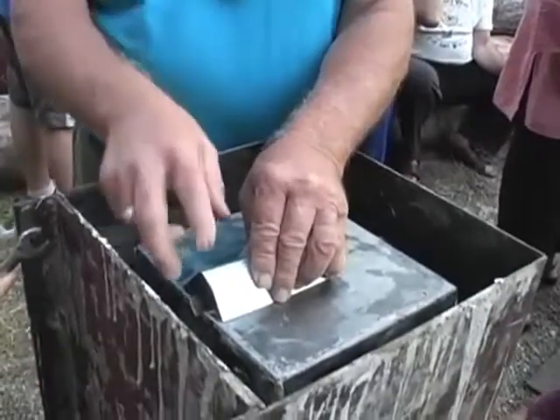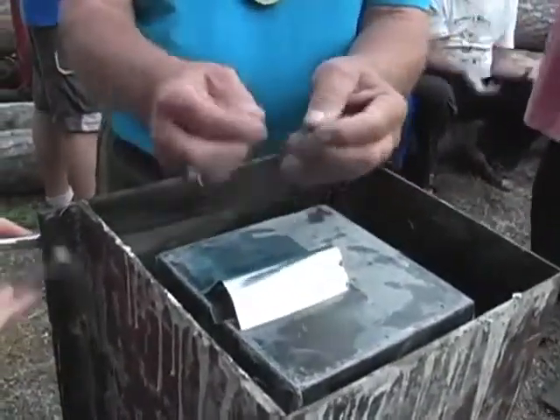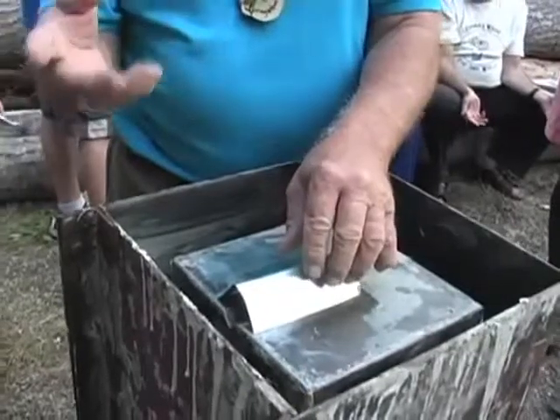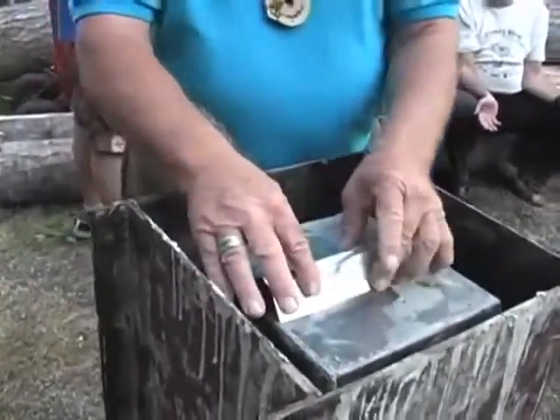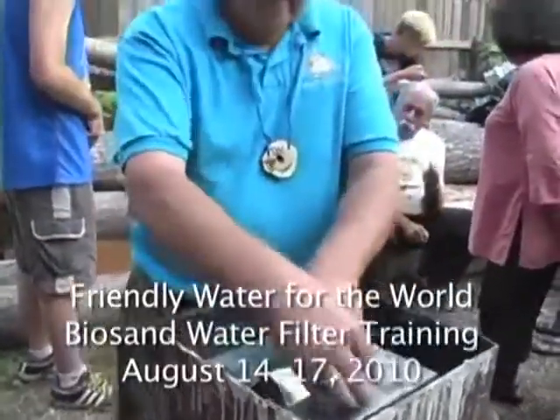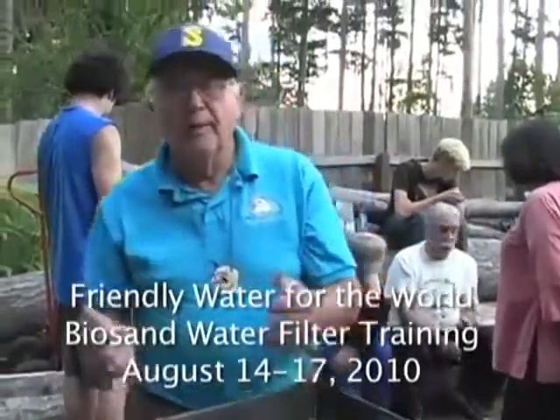Just as a precautionary thing, before we close it up, we'll take a little tape and put over the end of the tube just in case we have a leak. We have to look at every possibility. So once this is all closed, this is all taped down, then you can go ahead and put your grease on the top end of it and go ahead and fill your mold. You're ready to go.